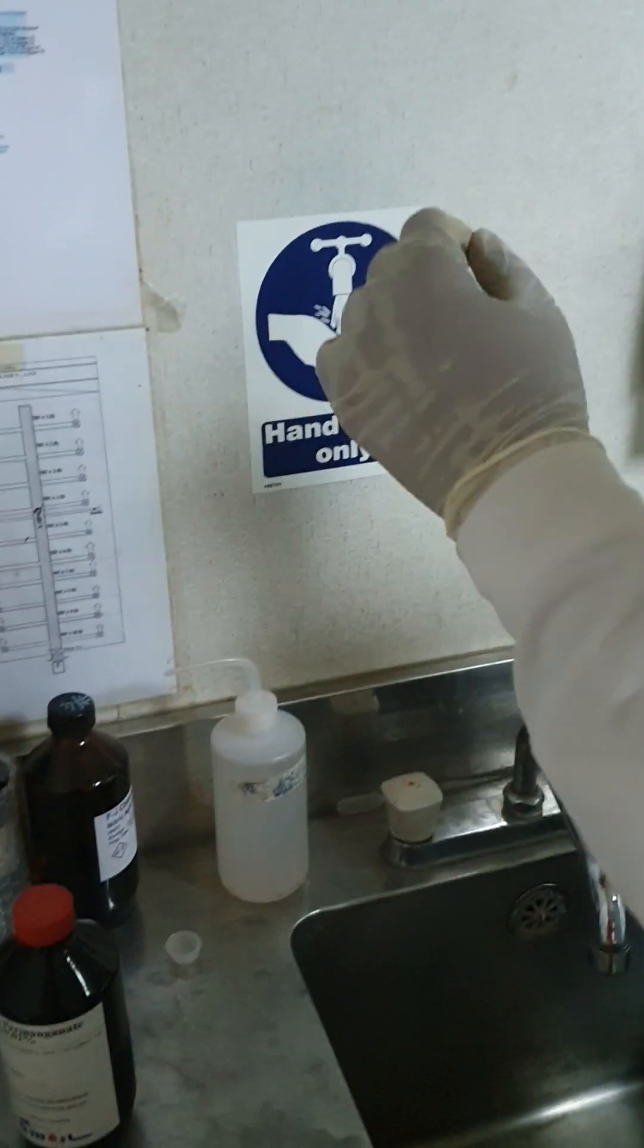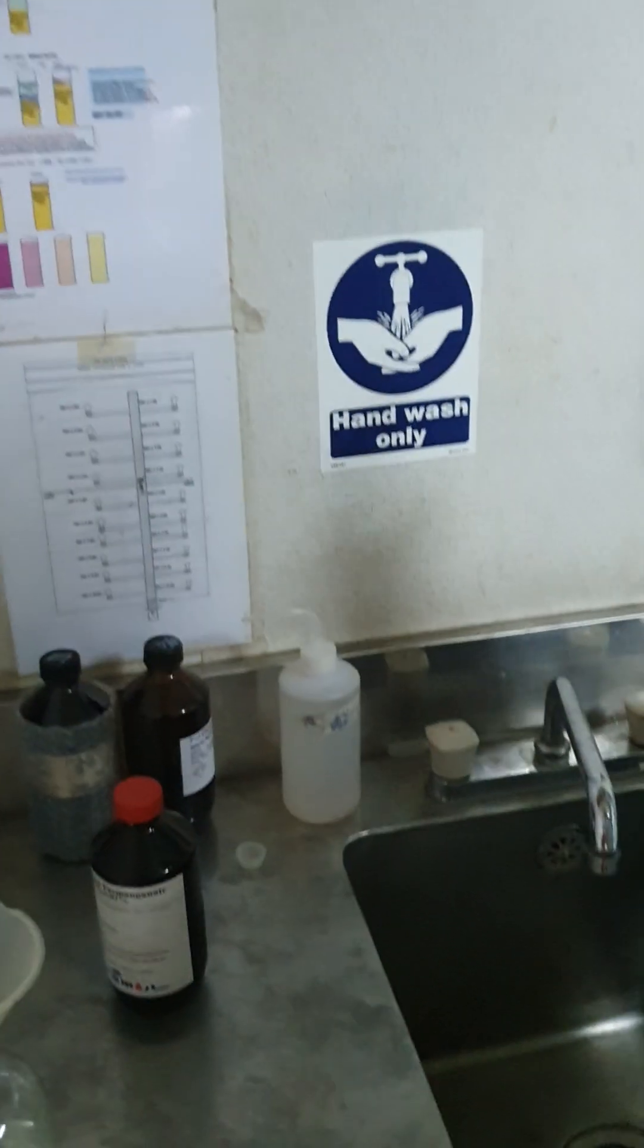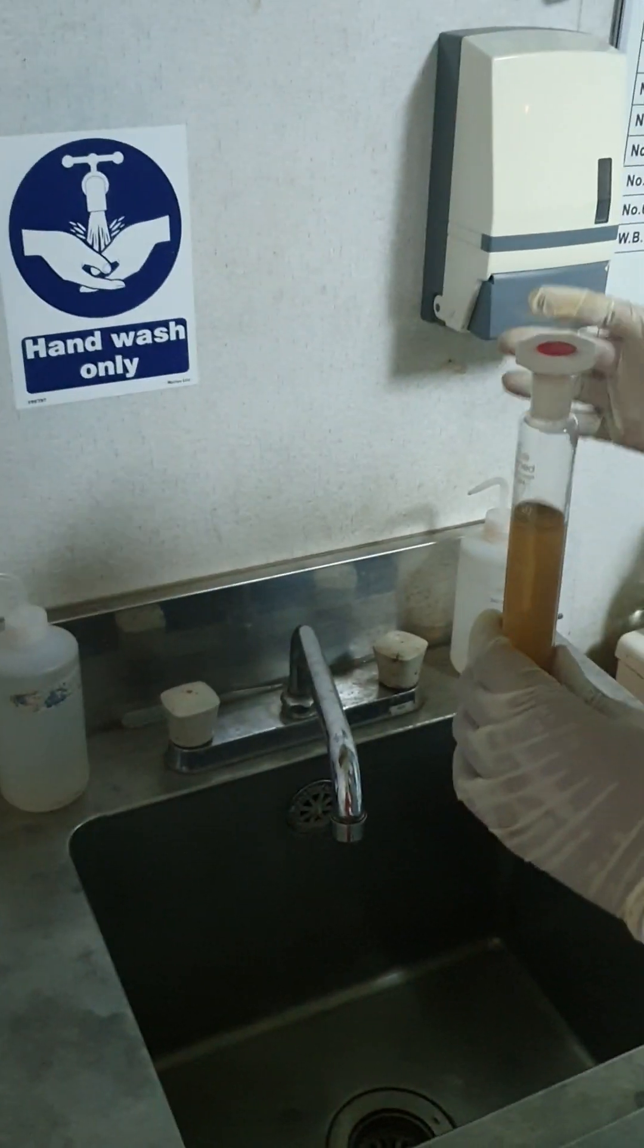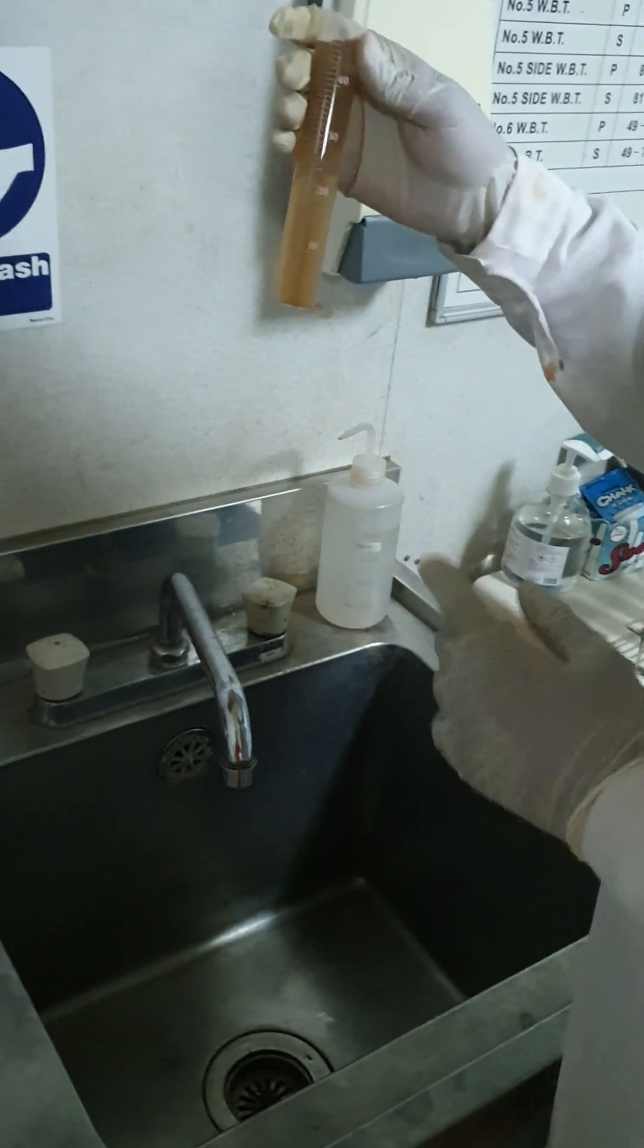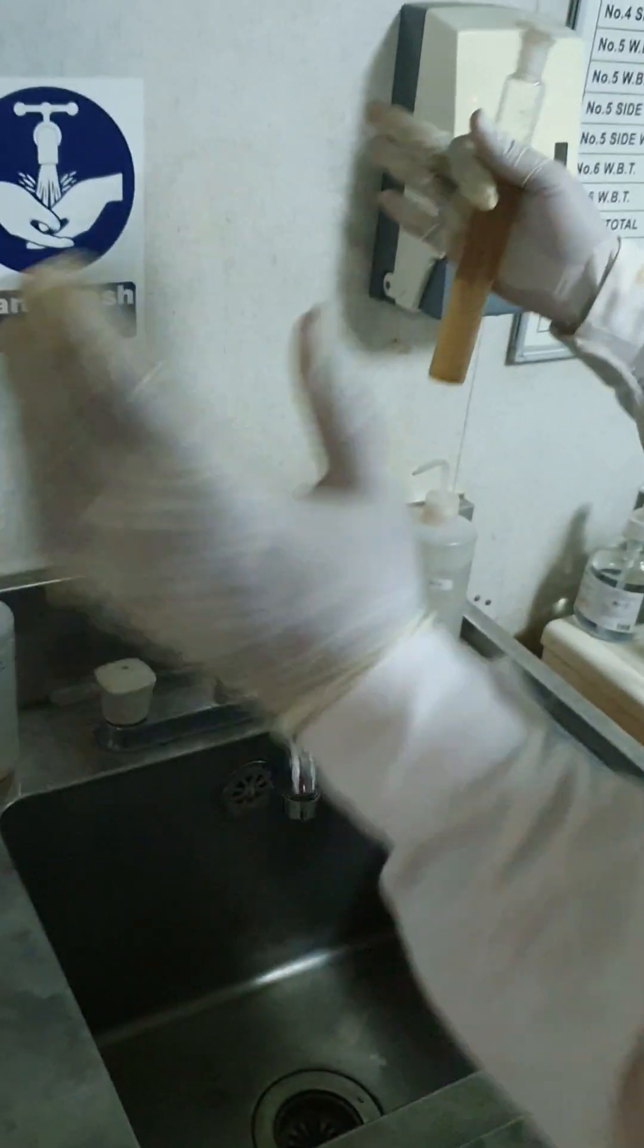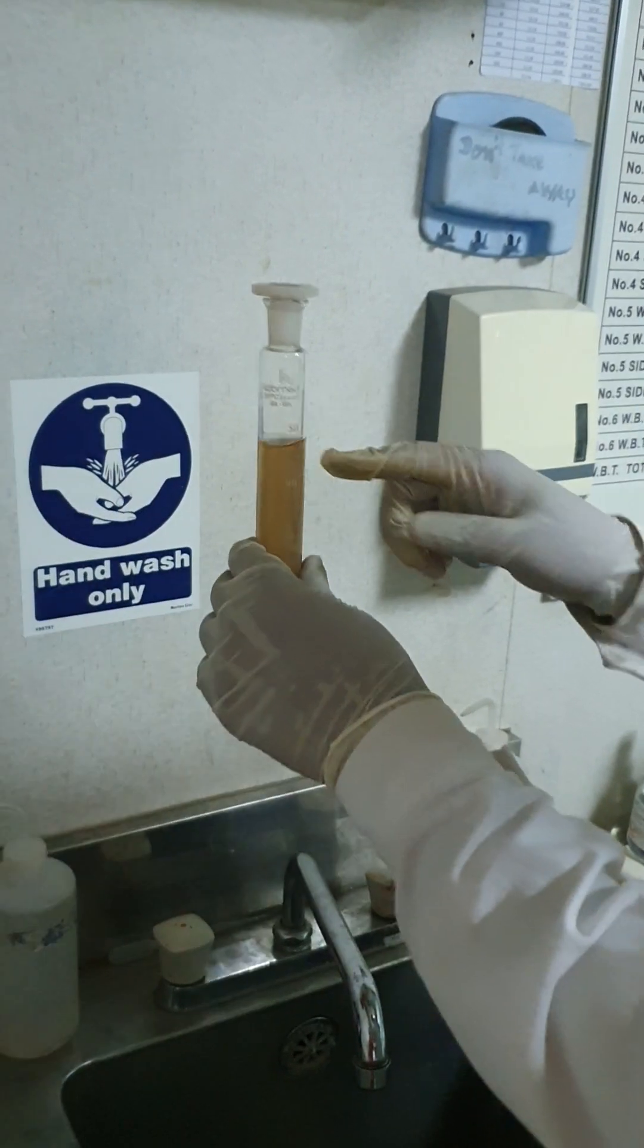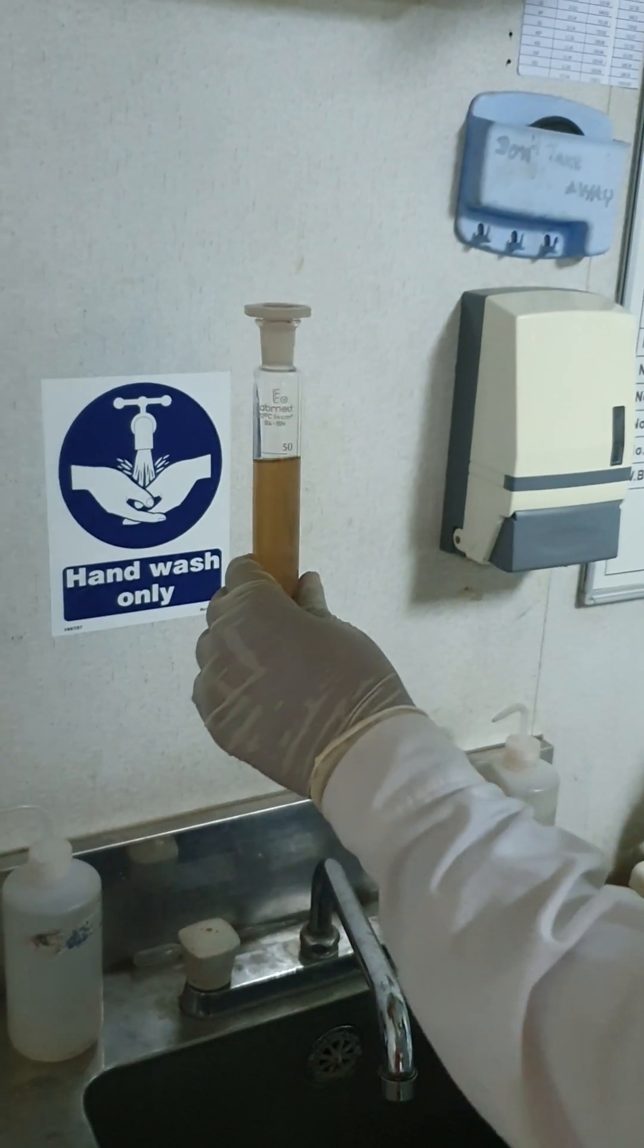So that you can compare that which one is going to be very dirty or fail very fast. And if you are loading so many cargo, I mean so many tanks with the same PTT, so better you can take all and then you can compare.